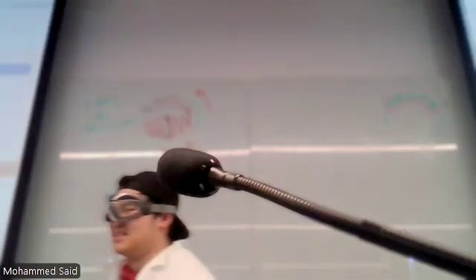When groups are done for transformation, please make sure you return the plates back to where they were originally. Also, when you're taking the colonies, take one or two small ones; one big one is enough. Remember aseptic technique when using the plates. Pipette tips, if they're open, there should be a lid on as well. The box should be closed.